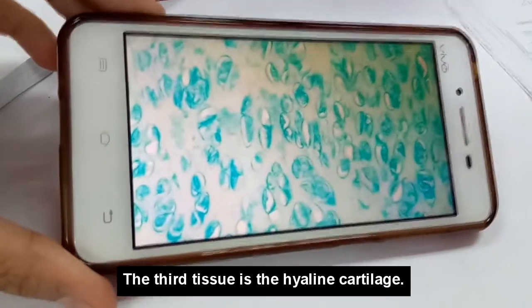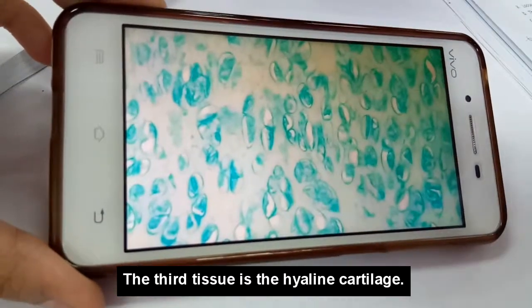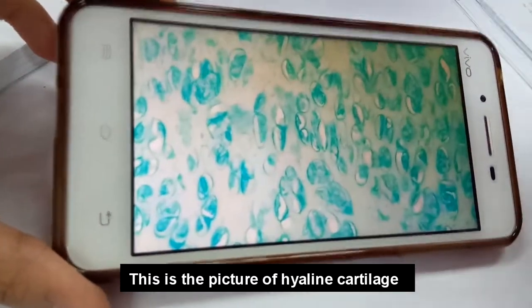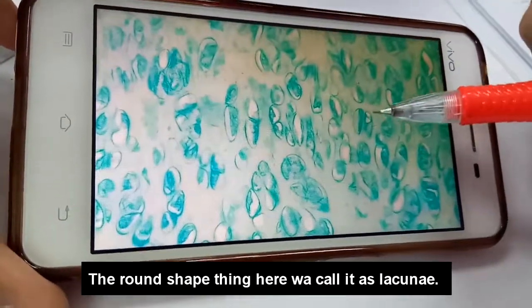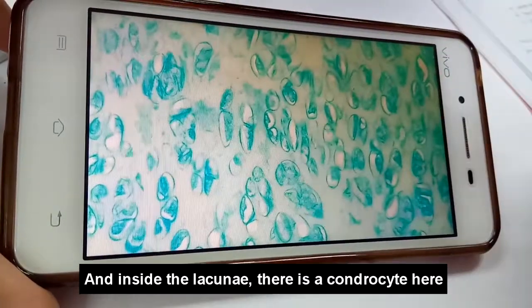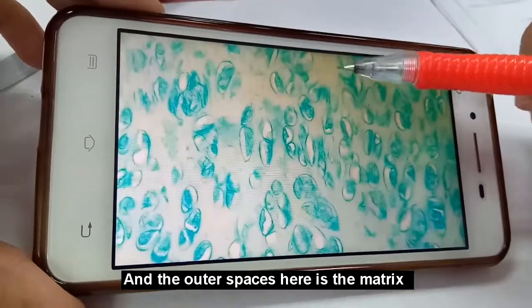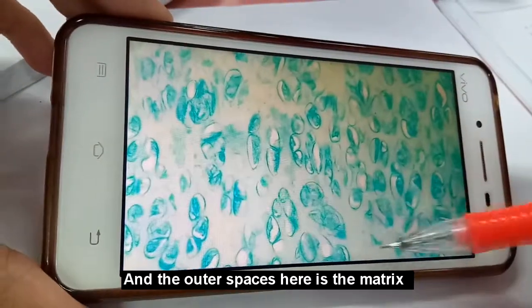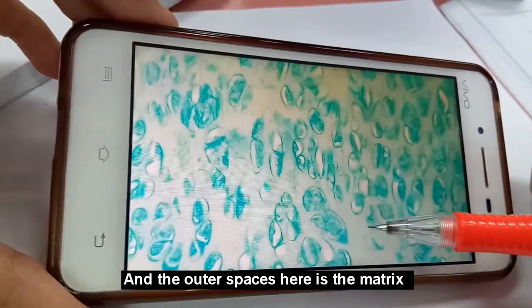Okay, the third tissue is the hyaline cartilage. So this is the picture of hyaline cartilage. As you can see here, the round shaped thing we call the lacuna, and inside the lacuna there is a chondrocyte here, and the outer spaces we call the matrix.